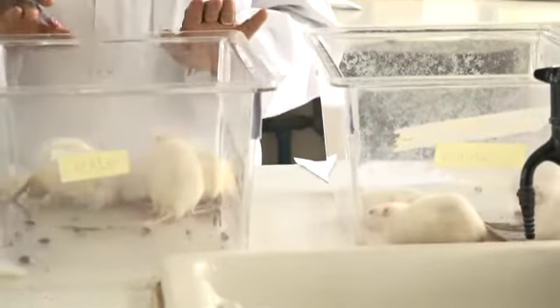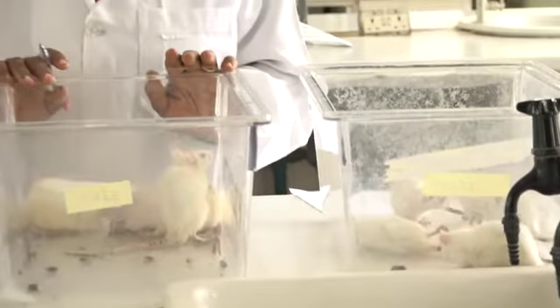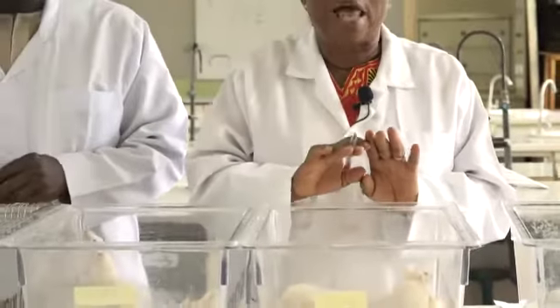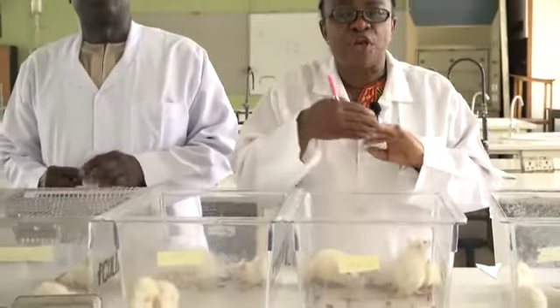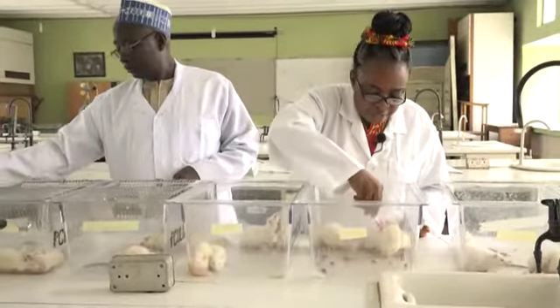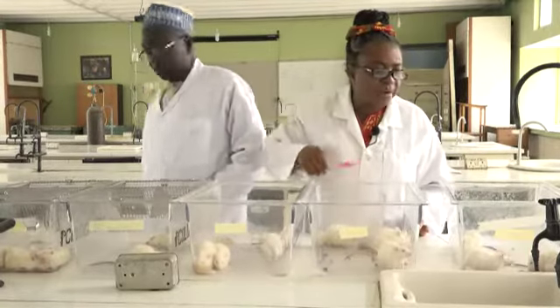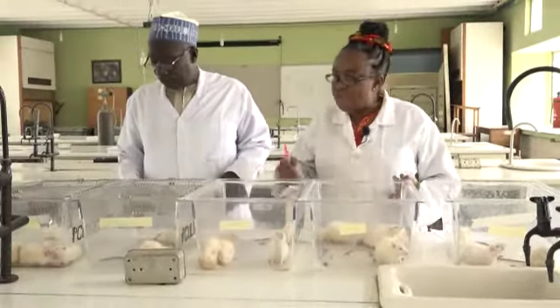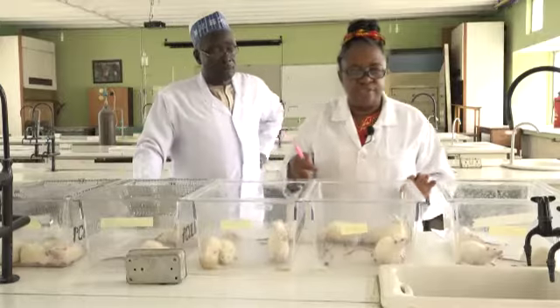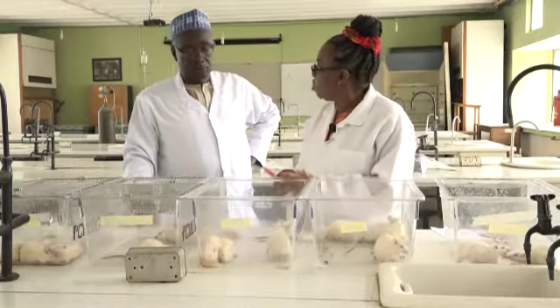The rats in group 2, they are male rats that receive normal saline. Normal saline is just like water. It's physiological with our body fluids. So these rats, we don't expect them to show any signs of toxicity. These are the normal rats. When you're looking at all the other cages, keep an eye on this one to compare them with the normal. Have you poisoned this? No.